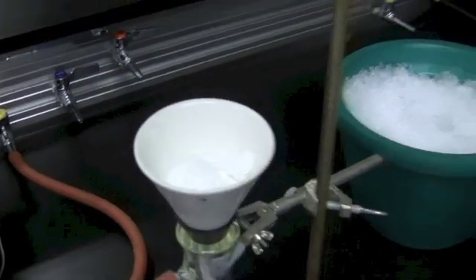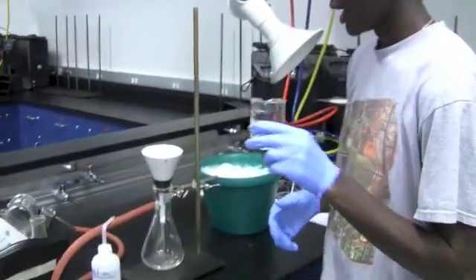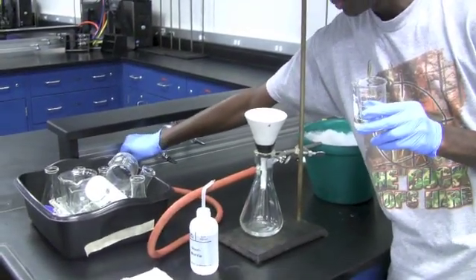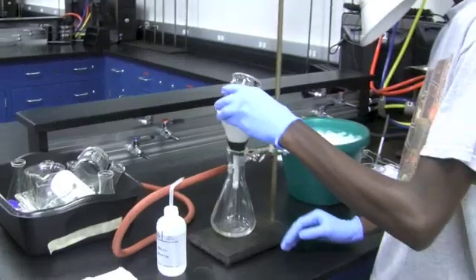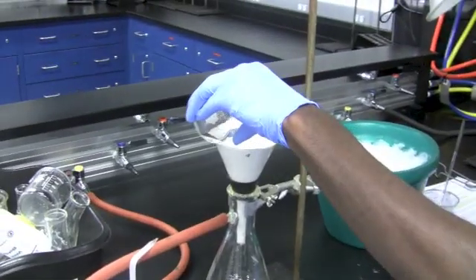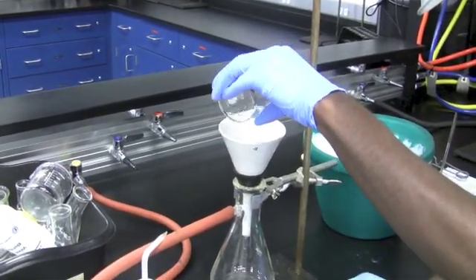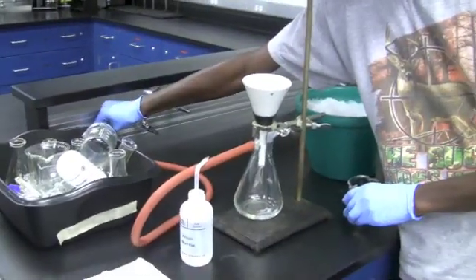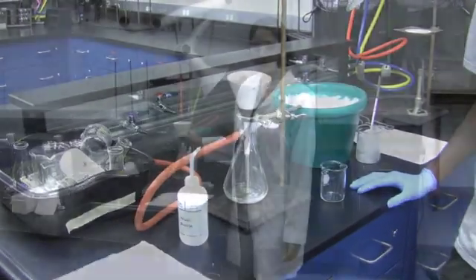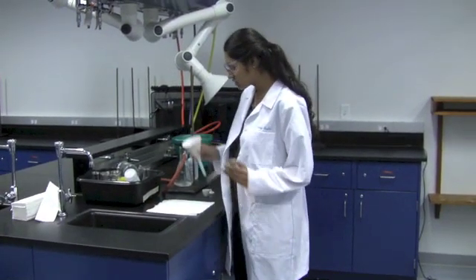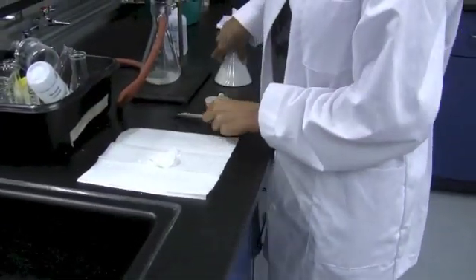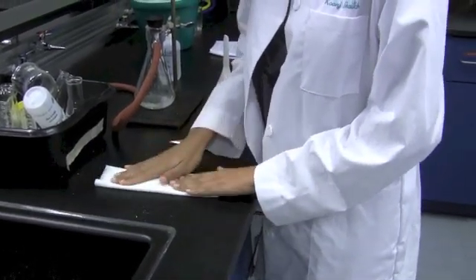Now after it's done, we're going to take our 50-50 water alcohol mixture and carefully wash the crystals, but before you do so, make sure to turn the vacuum off, and using your mixture, try and wash all the crystals like so. After doing that, you turn the vacuum back on and wait for it to filter. After you wash your crystals, you want to transfer it to paper towels to dry. Make sure you label your name and save it for next time.